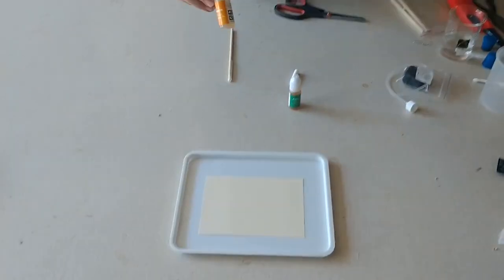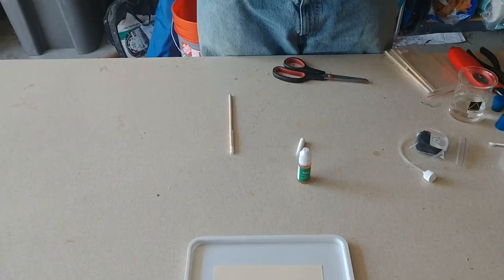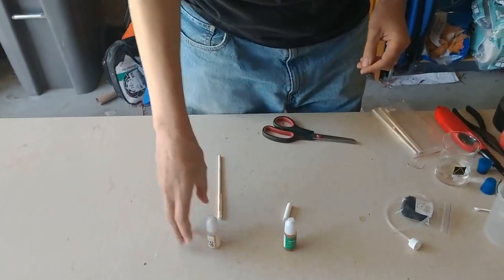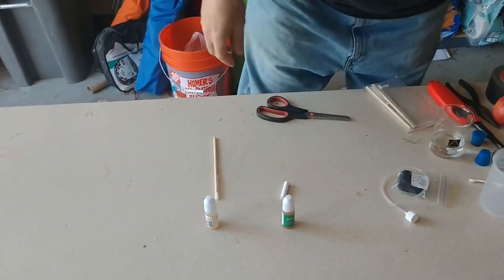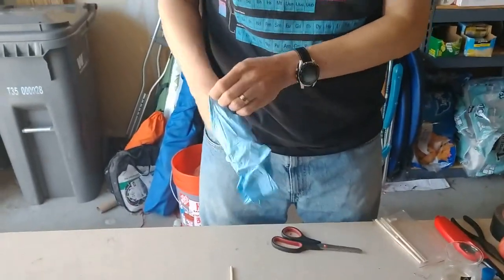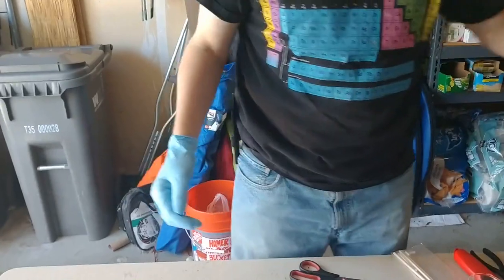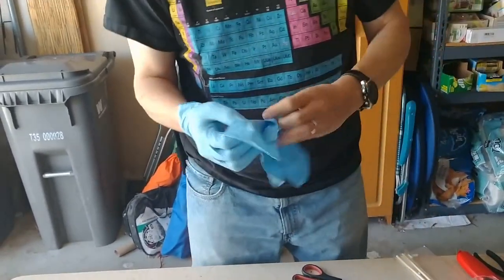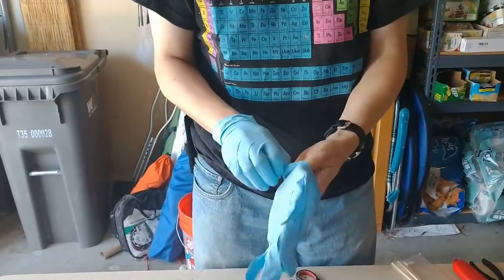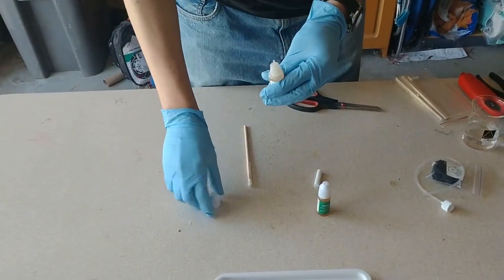If we can move down here. I have here a bottle that has tannin in it and I'm going to take the tannin and put, well first I'm going to put on a glove because I don't want this stuff on my hands. It's not toxic, it's not staining unless I get both of them on there and then I'll have ink on my hands. So I'm going to put on gloves and you may have noticed I already had my goggles on because I wanted to get started with that.